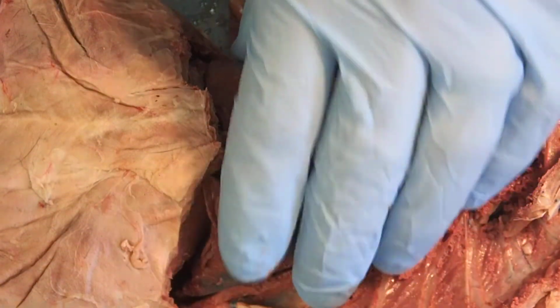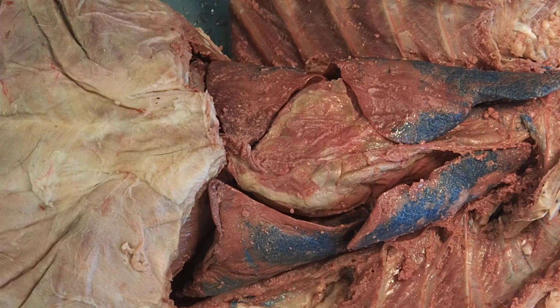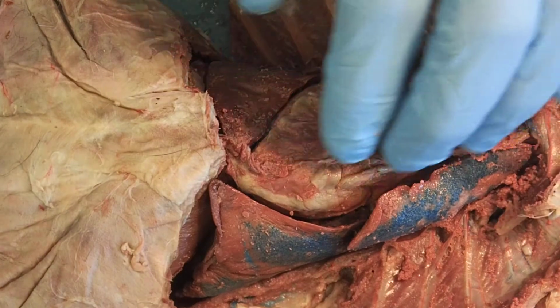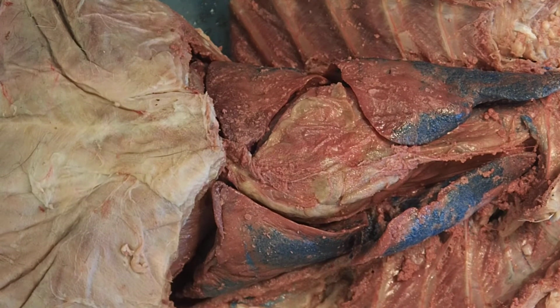So that site of gas exchange all is going to occur there within the lungs, and in particular at the alveoli. The trachea itself continues to, as we go further down, branch into smaller and smaller sections, hence the primary, secondary, tertiary bronchi and the bronchioles, ultimately ending into the alveoli.